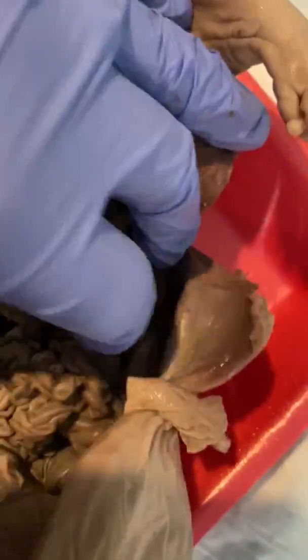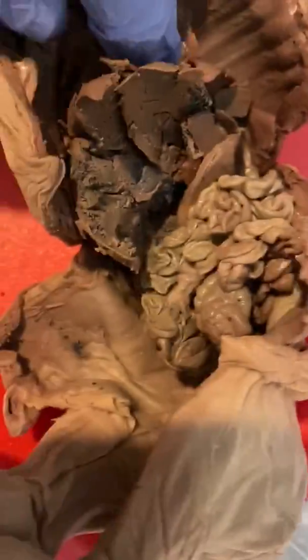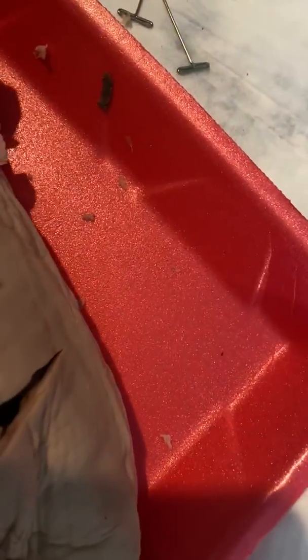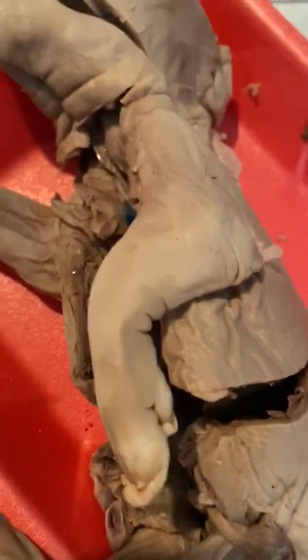Like I said, I know where most of it is, like on the human, but it was hard to find in this little teeny tiny pig that's pretty much mangled now. But that should be it. I think I covered it mostly all. And yep, thank you.